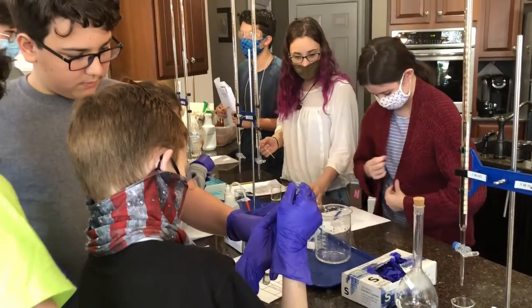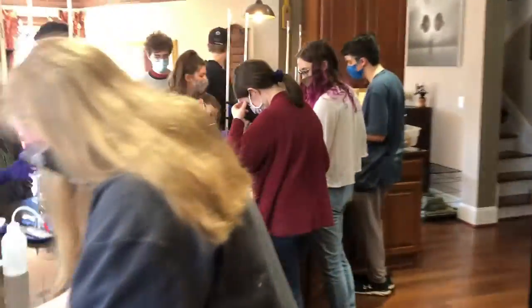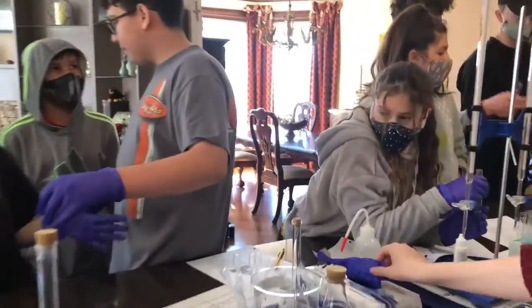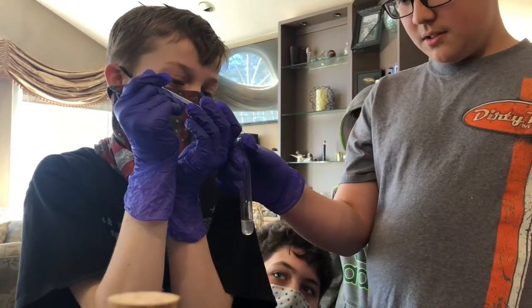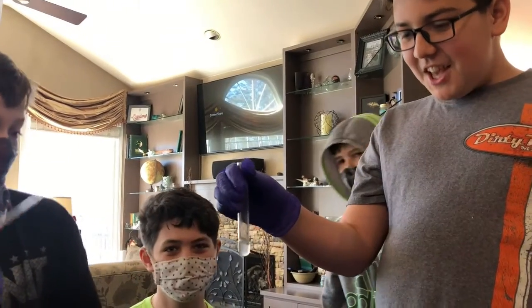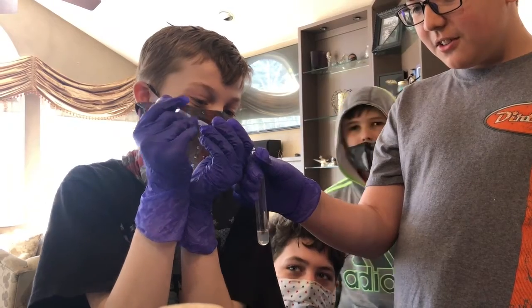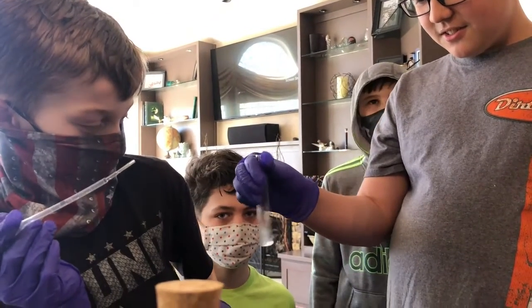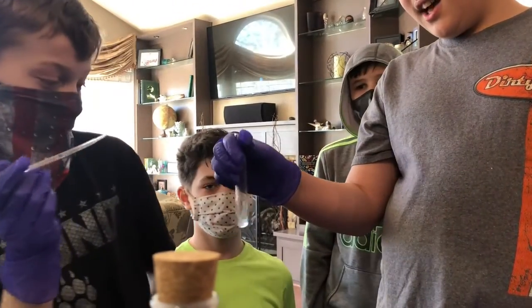Oh, look at that! Are we supposed to shake it? Yes. Give it a little shake every time. Yep. Good. When you shake it, it goes away. Yep, when you shake it, it goes away. So you're going to have to keep doing it. Go! I see the purple. Like the purple. Let's go. Let's go. That looks like 2. We're up to 4. All right. Exactly. It's going to be a lot more than 4. You're going to be a while.